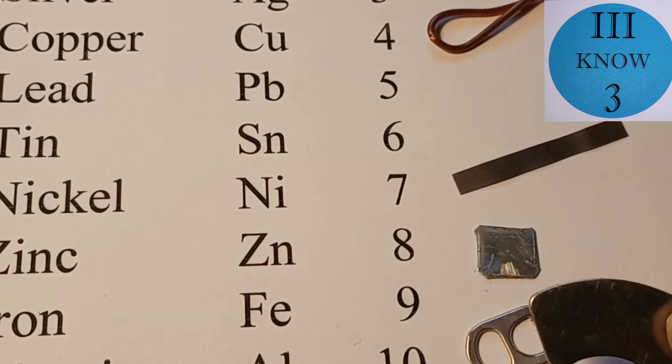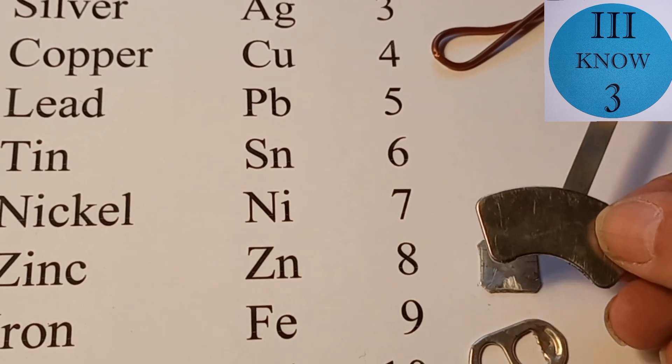Here is the precipitant that I gathered from this last run. Fun fact of these four metals only one's magnetic and it's nickel.